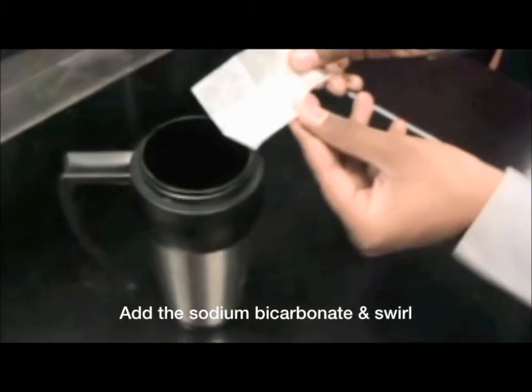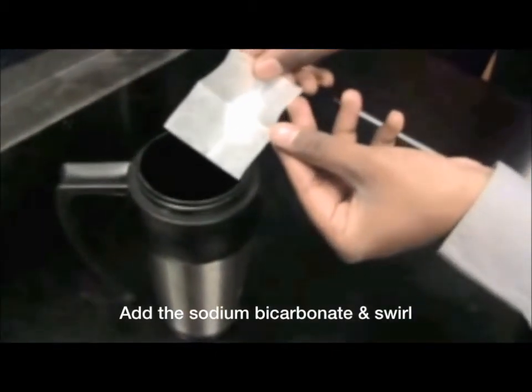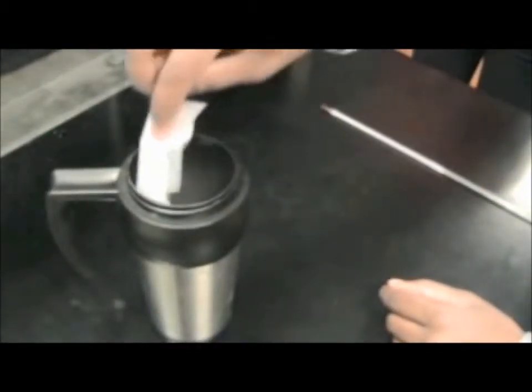Carefully add all the sodium hydrogen carbonate to the thermos and swirl the container until the reaction is complete. Take note of the sizzling that occurs. Record the highest or lowest final temperature.